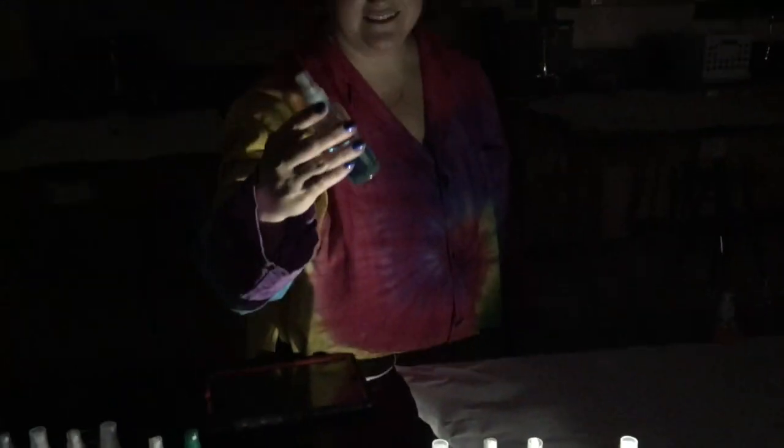And sometimes if you have 2 Bunsen burners in a row like that, you might actually spray both of them unintentionally. Okay. All right. Next we've got CuNO3. The last time we saw this solution, it was in the copper cycle lab. Oh, whoa, surprising. That's pretty cool. Although it is a blue solution, it may produce a different color flame.